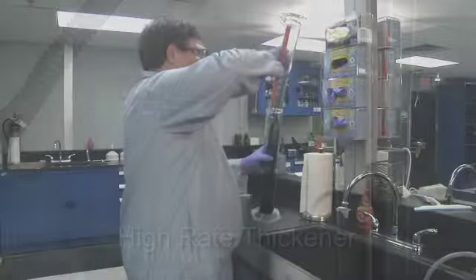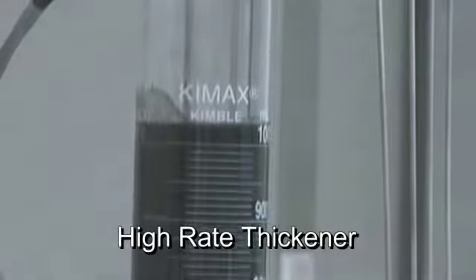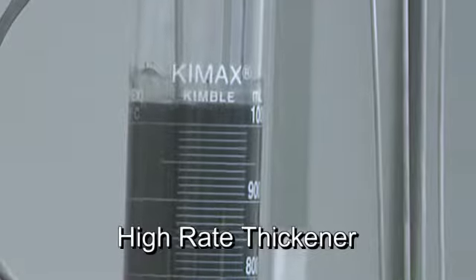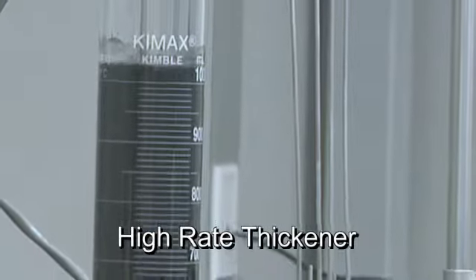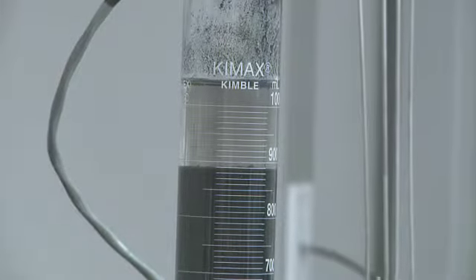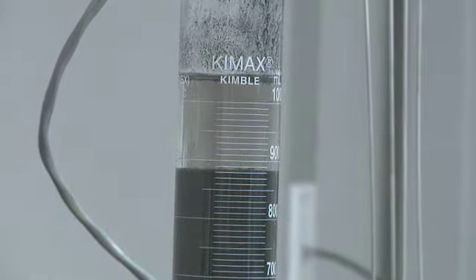To determine the size for a high-rate thickener, the settling rate must be determined. The sample is mixed and the solids level is marked at 10-second intervals for the first minute, and then at 1.5 minutes, 2, 3, and 5 minutes afterwards.